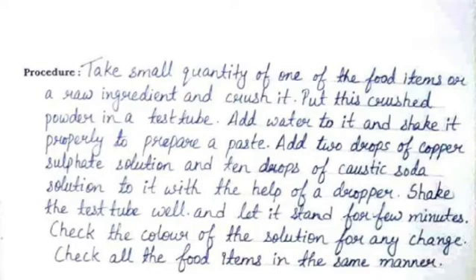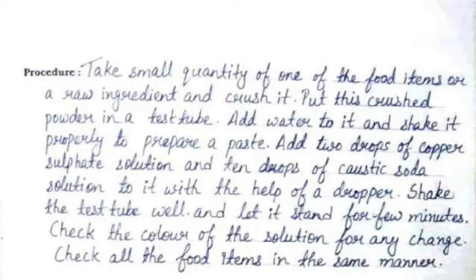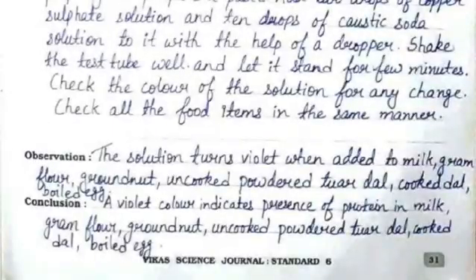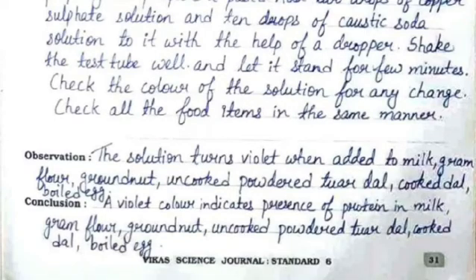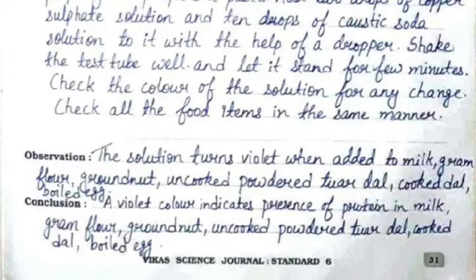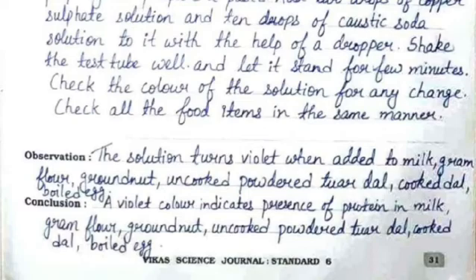Check the color of the solution for any change, and check all the food items in the same manner. The observation is: the solution turns violet when added to milk, gram flour, groundnut, uncooked powdered toor dal, cooked dal, and boiled egg. The conclusion is: a violet color indicates the presence of protein in milk, gram flour, groundnut, uncooked powdered toor dal, cooked dal, and boiled egg.